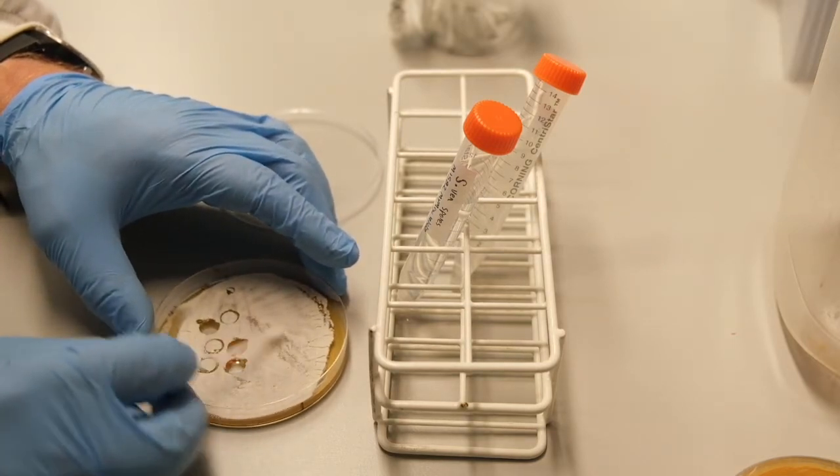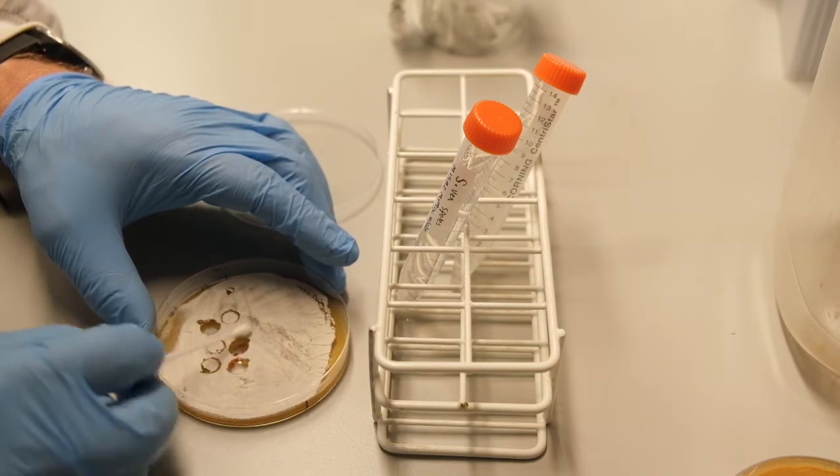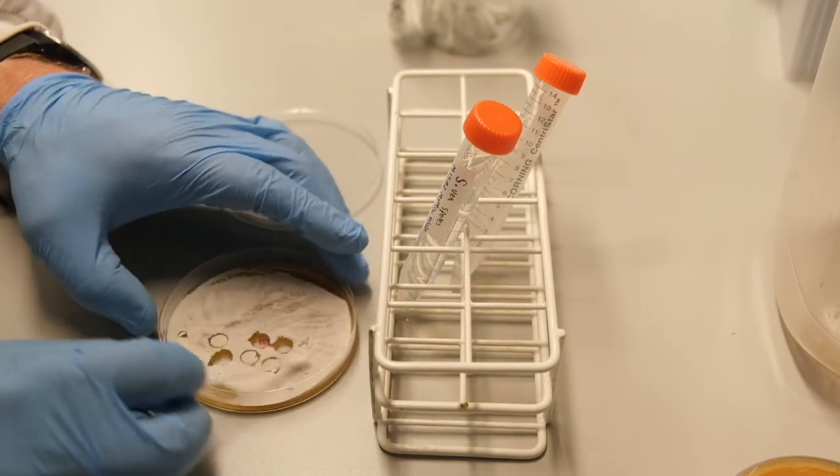These spore stocks can be stably stored for many years at minus 20 degrees centigrade.